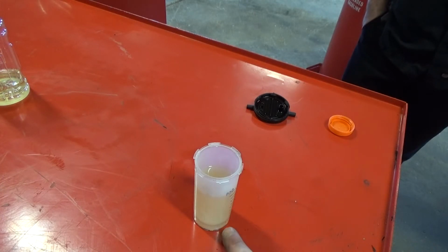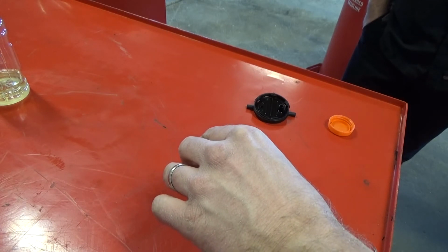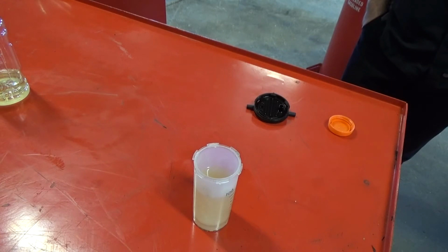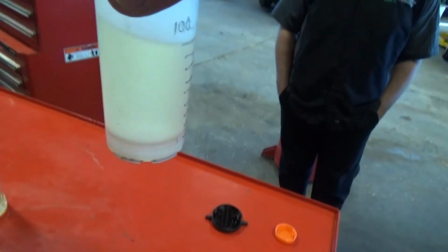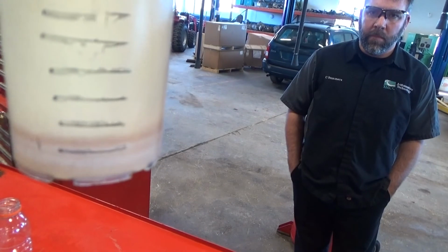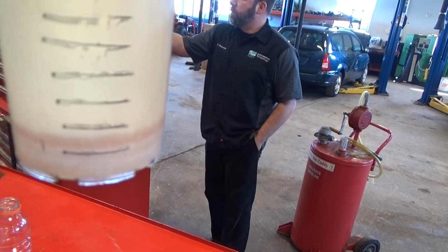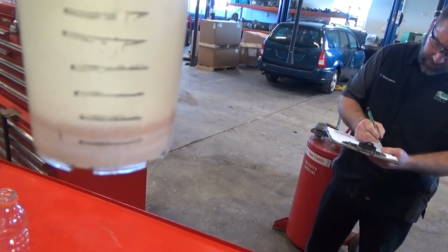But you can definitely see a division line there, and as I tilt it, you can see the water level and the fuel level kind of separating there. So hopefully you guys can see that okay on the video. I can hold that up again and see if you can see that all right. So there we are, 10%, first black line there, and it went up. And again, it's probably not quite halfway, or a little bit over halfway. It just depends on how you look at it.